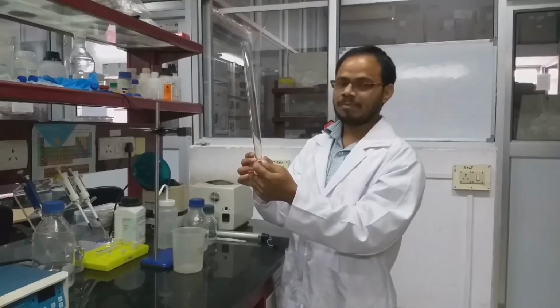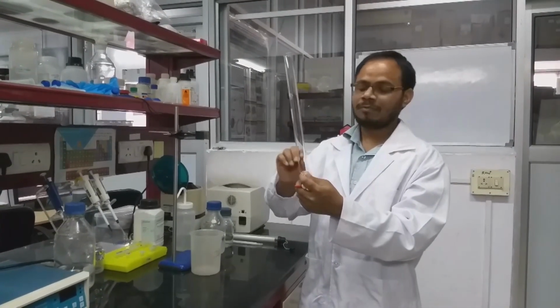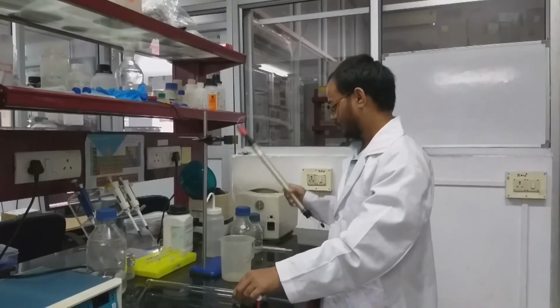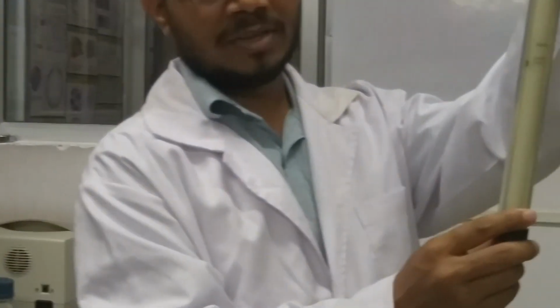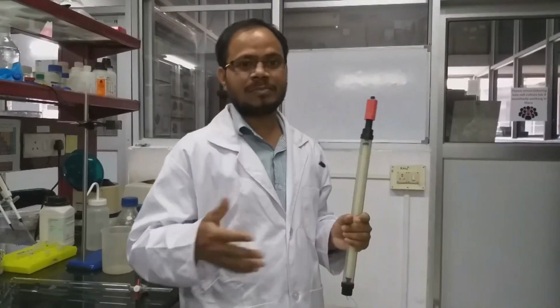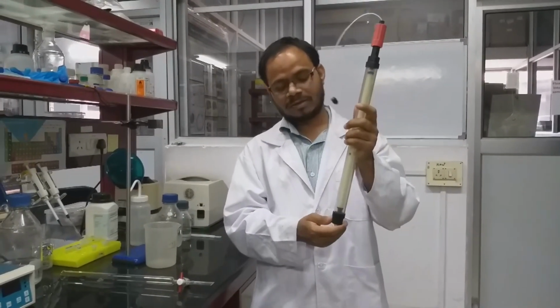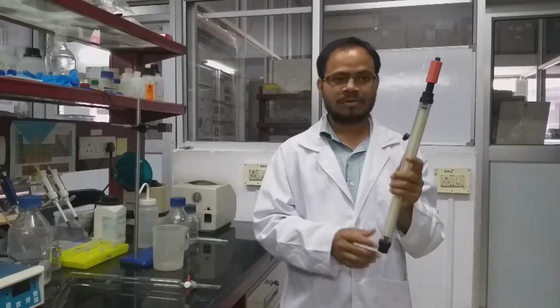At the bottom of the column there should be a sintered filter in pre-packed columns, which will prevent the beads from going through the outlet. Here, if you see, in pre-packed columns there is a sintered filter at the bottom of the column, and both the outlet and inlet contain sintered filters. At the inlet, which is mainly the buffer inlet, any particles which would obstruct the flow are held back on top. And the outlet one prevents passage of the beads through the outlet.